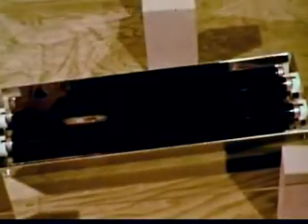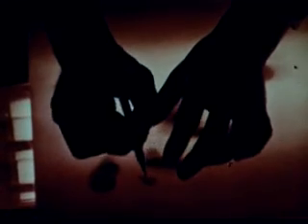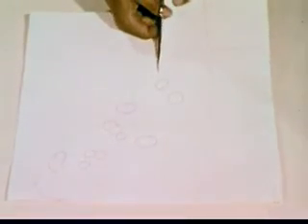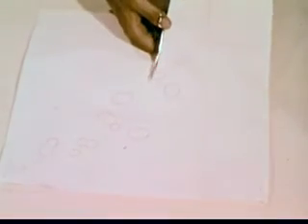But if we place an ultraviolet light under the dried paper, we can see that the solvent has distributed the components of the chromosomal material. The solvent front has carried the chromosomal material along and deposited the components according to their molecular size and solubility. Thus, different compounds derived from the chromosomes are separated.